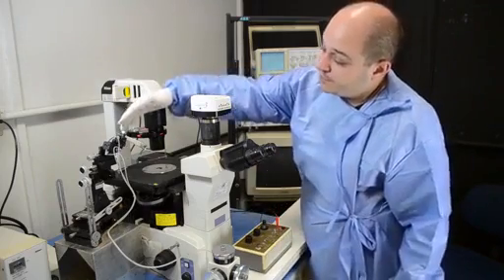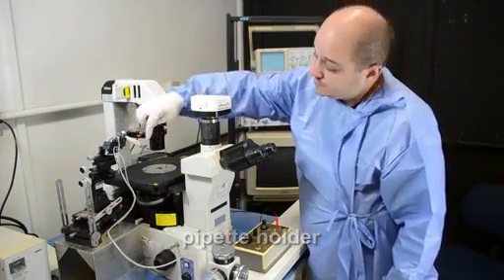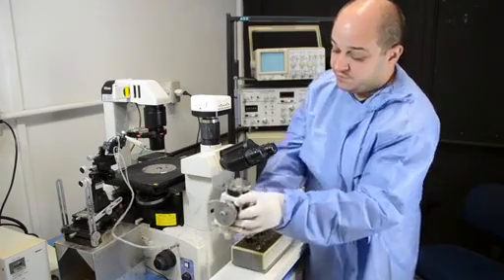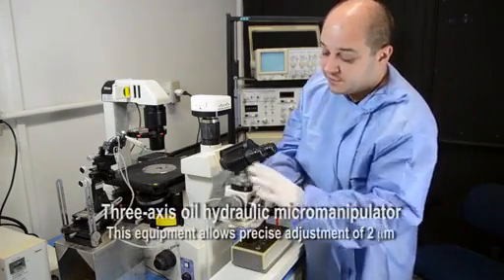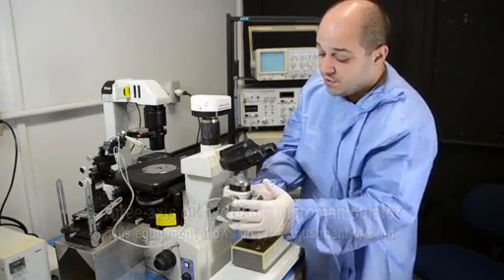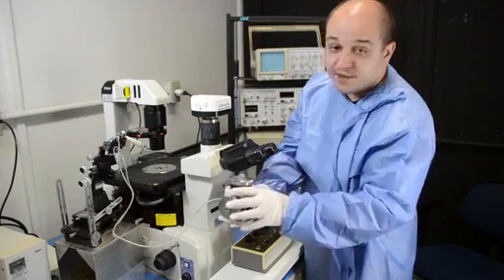Next, we have the holder where the microelectrode is connected, and the micromanipulator that's connected to the holder and allows the movement of the microelectrode in the three axes: Z, Y, and X.